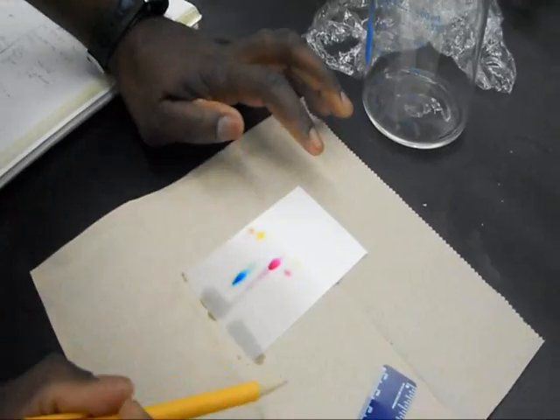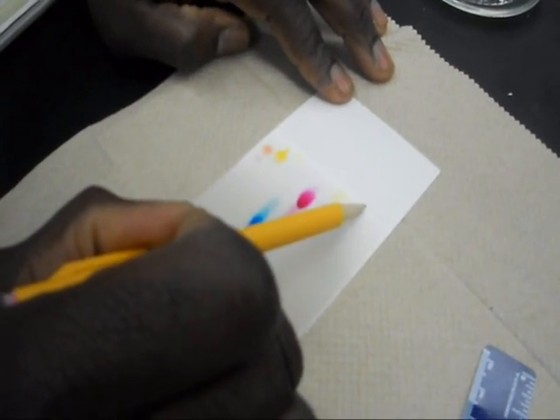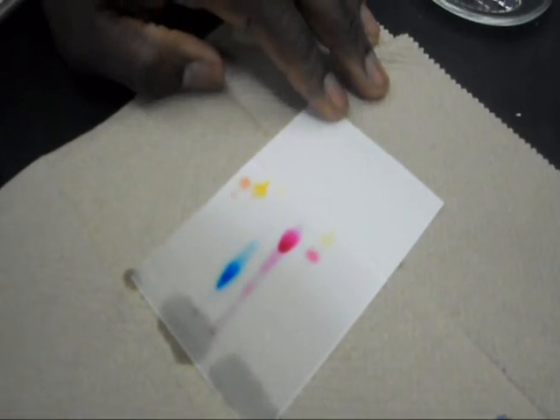We're going to draw our solvent line, which is here. It's about there.